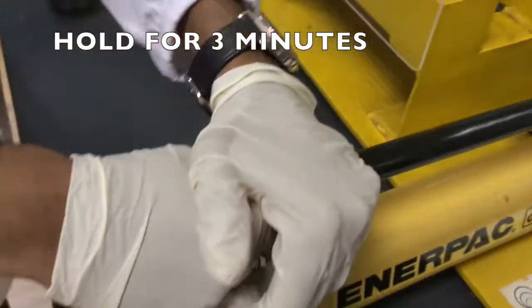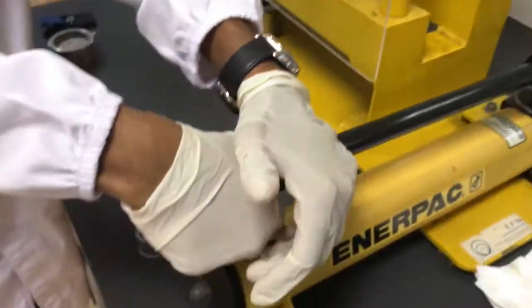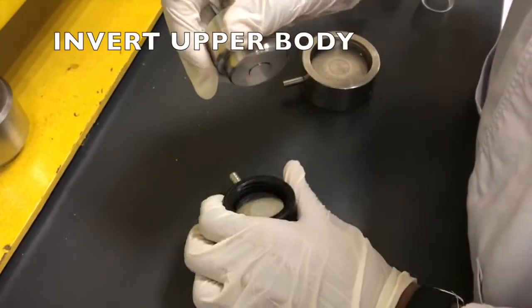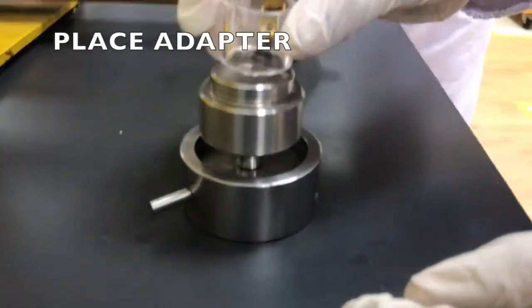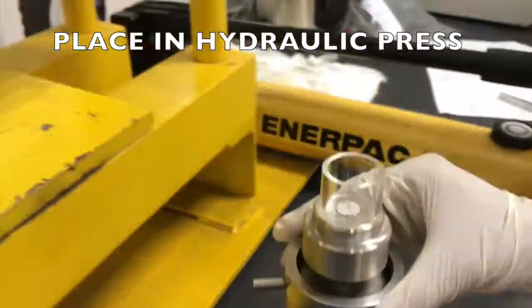After this, release the knob anti-clockwise to return the piston and remove the pellet die set. Disassemble the die set, invert the upper body and place the set together with the adapter into the hydraulic press as shown. Once again, close the shield before applying pressure to remove the pellet.